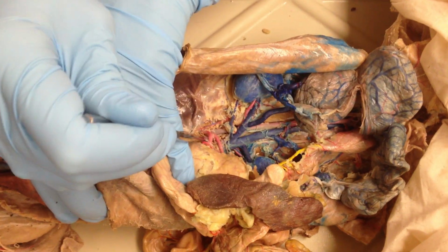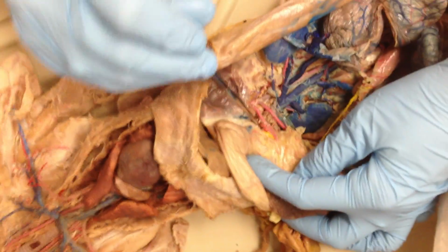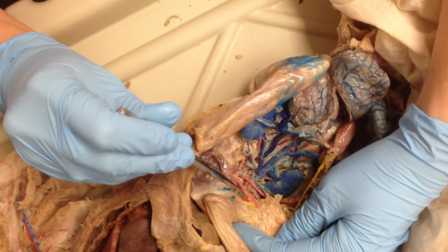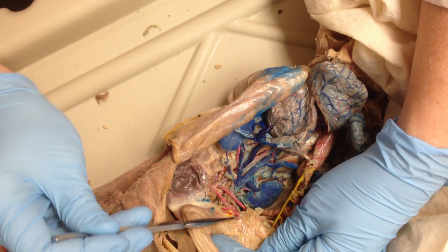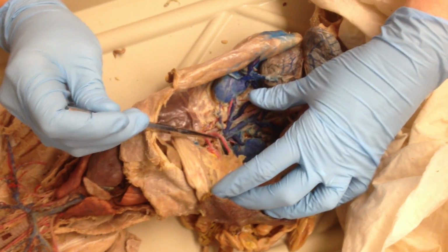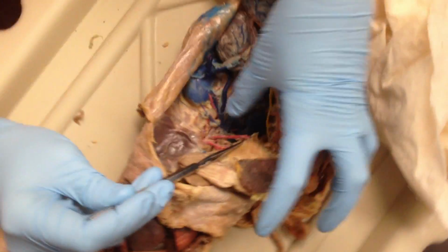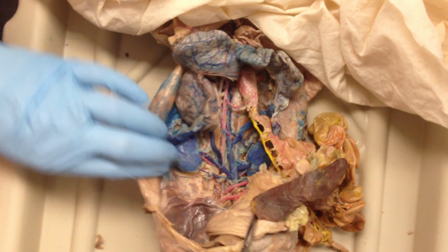The first branch here is the celiac trunk. And then it splits into three branches. So the first branch goes towards the liver. This little guy is your hepatic. The second one is your gastric going to your stomach. And then your splenic going straight up. It's going to your spleen. So those are your hugs, HGS. The next branch off of that is going to be your superior mesenteric. And that goes to this whole intestinal system, which we'll come back to in a minute.